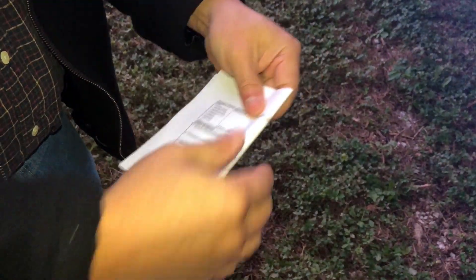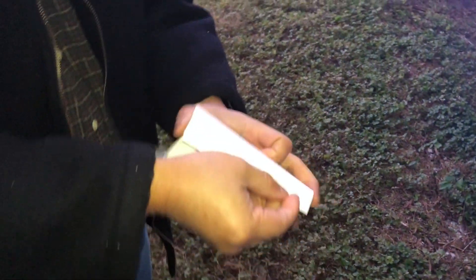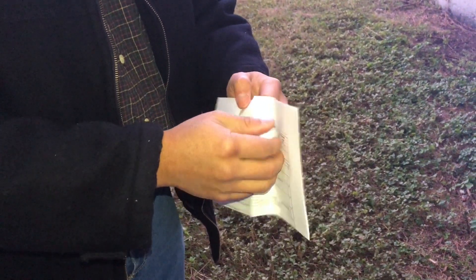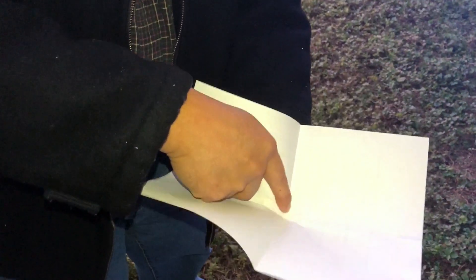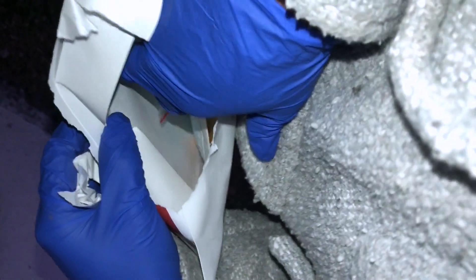To create a collection paper, just take any paper and fold it in half like this, then fold it again. You don't have to be very precise. What I'm trying to do is create a sheet of paper that can be used as a collection bucket — if you point it down, everything goes into the middle like that.